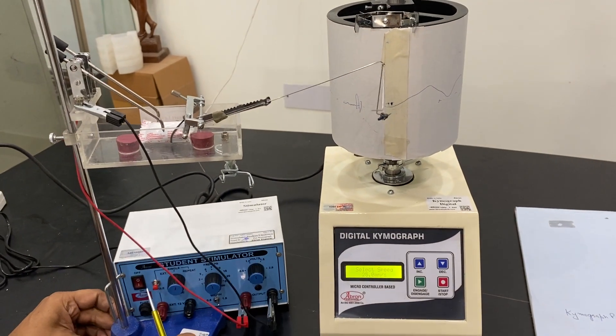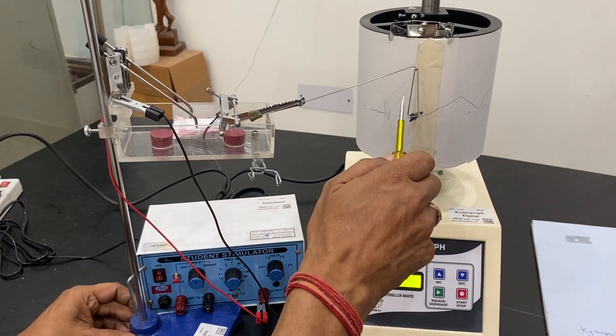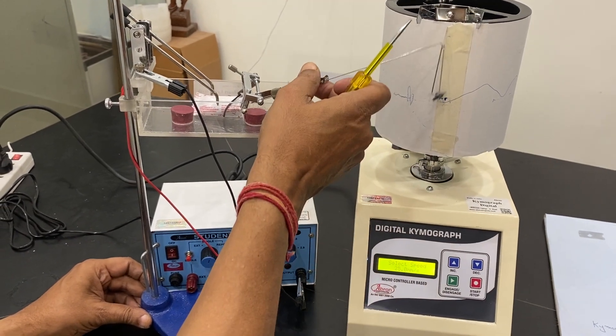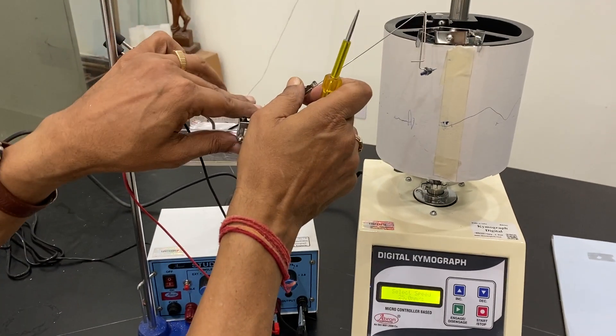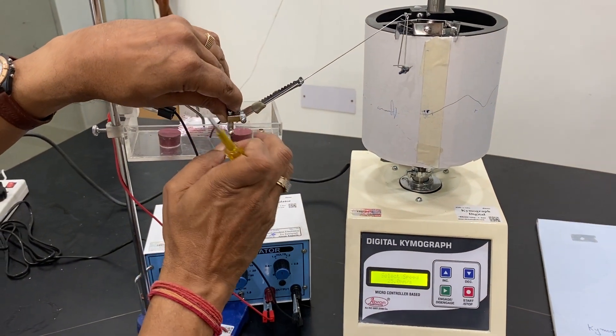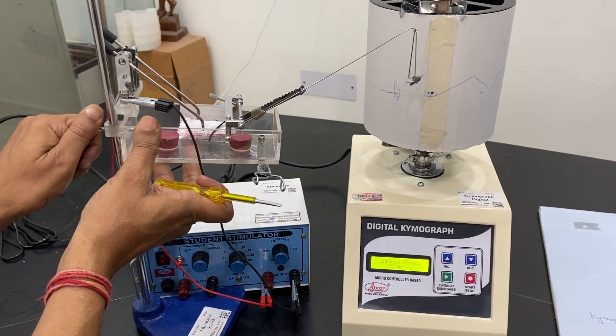I can adjust this balance slowly so that it is moving freely. See, there is a movement here and then movement can be recorded. I can bring it down and center that so that it works well.